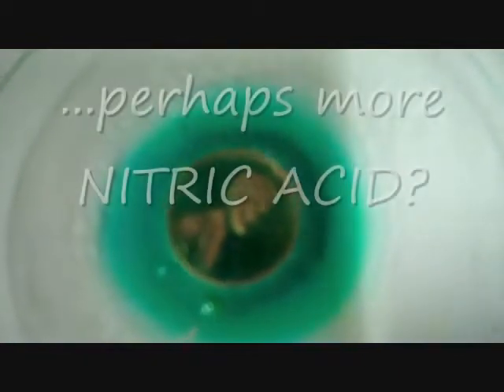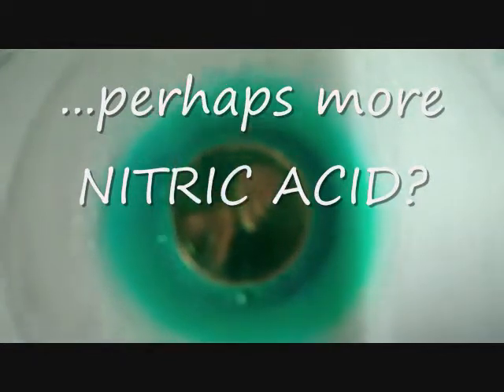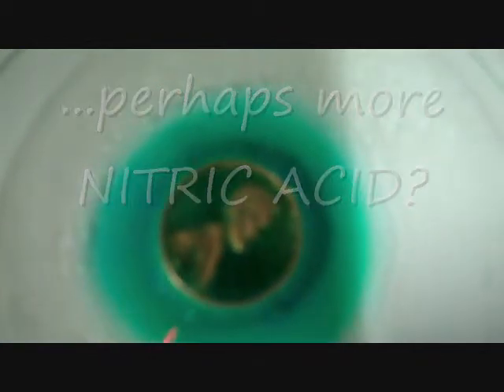What we're seeing is different oxidation states of copper. Eventually everything is going to end up at copper two. I think we're seeing a little bit of copper plus one there.